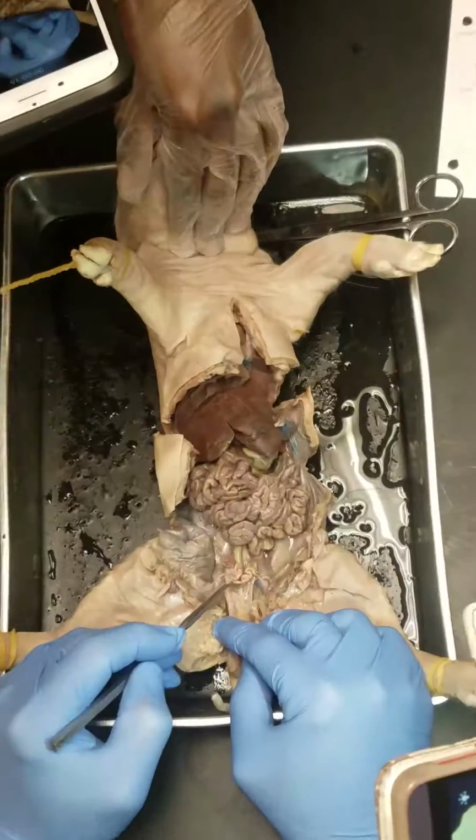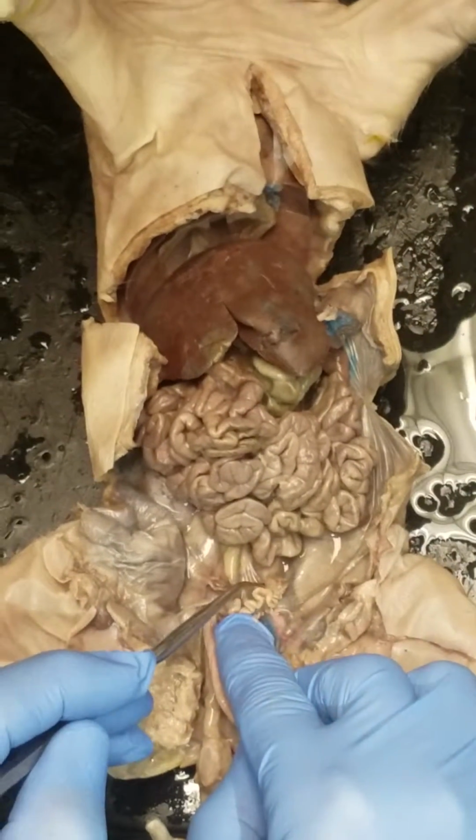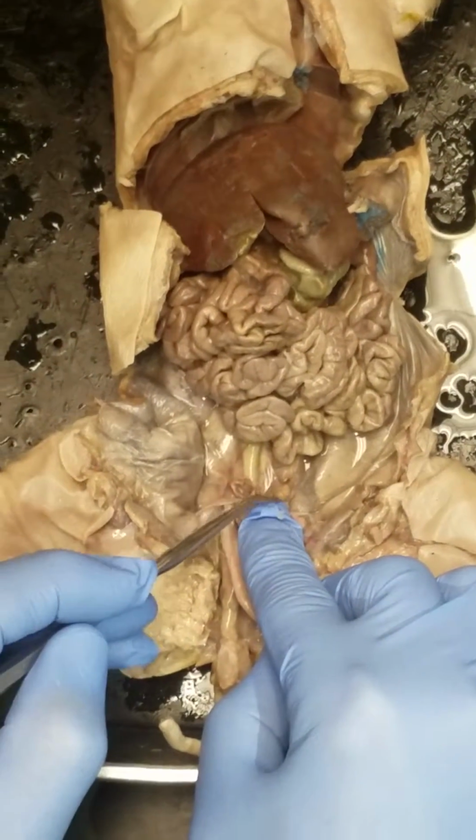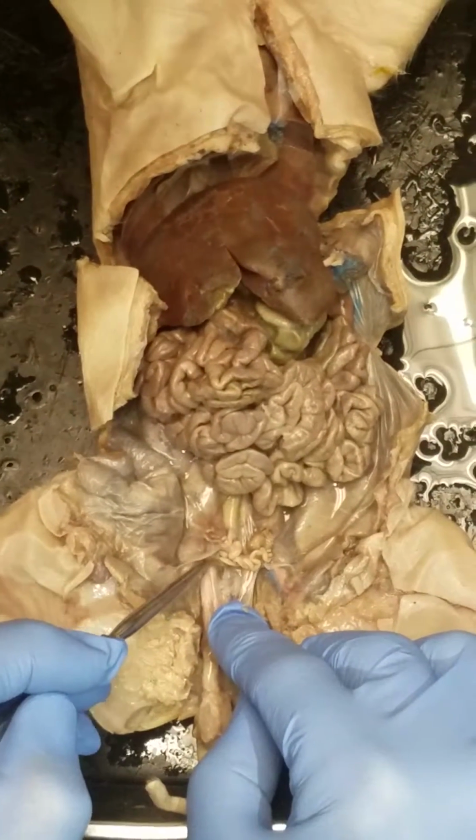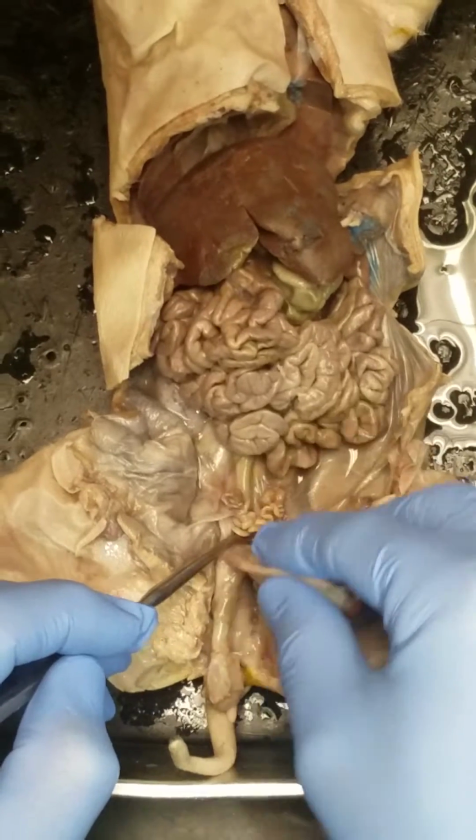The little curly things are the horns of the uterus. You go up to the end. You find the little bean. That's an ovary. So, horns of the uterus, ovary. I'm not going to ask body. It's too hard for me to label. Then I flip this back.